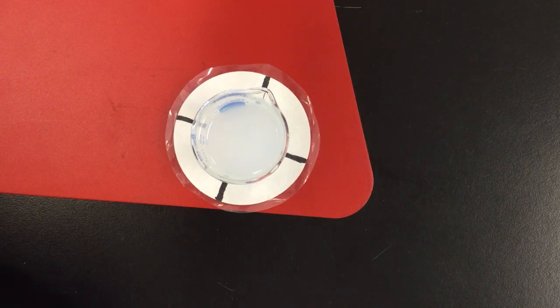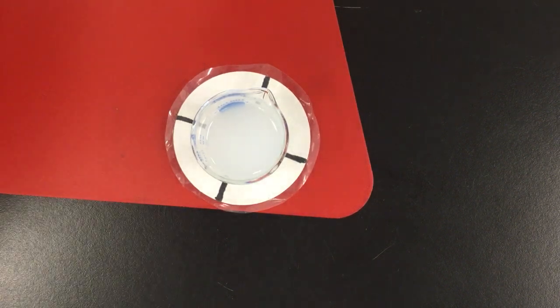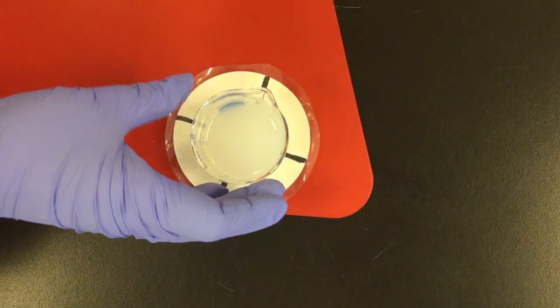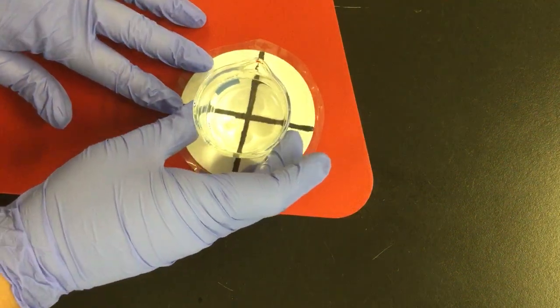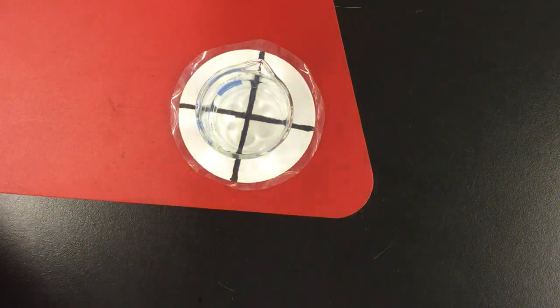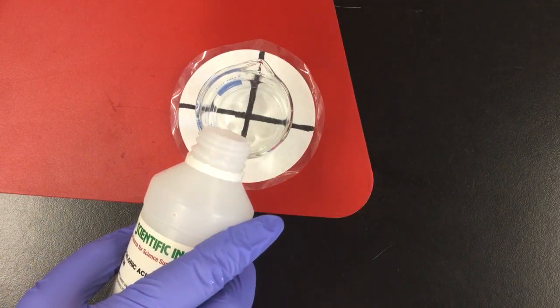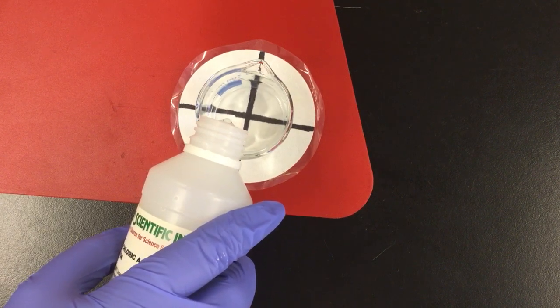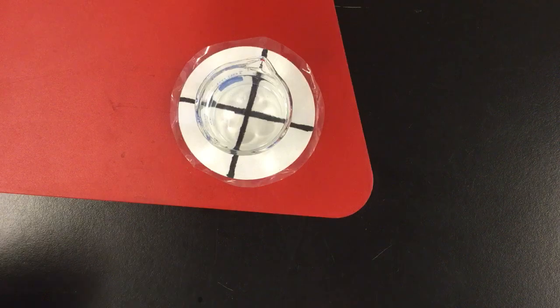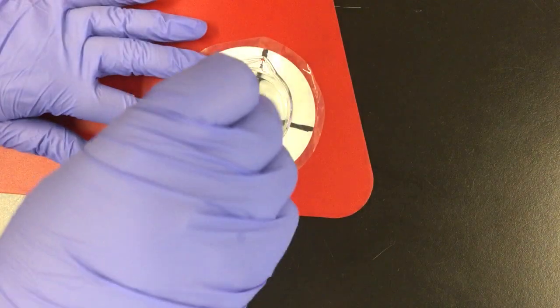Okay, I'm getting the next one all prepped here. All right, you for sure should have stopped your timer at this point. Or sorry, second to last trial. This one is 40 milliliters sodium thiosulfate, 10 milliliters of water, so again, more concentrated, and adding the hydrochloric acid now. A little stir.